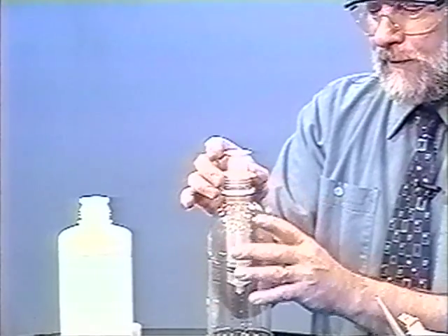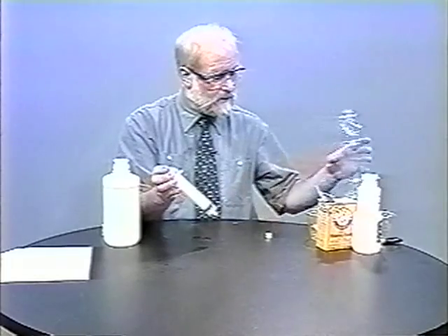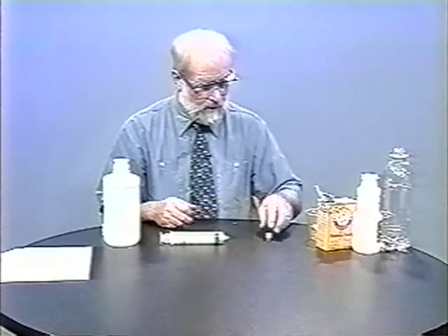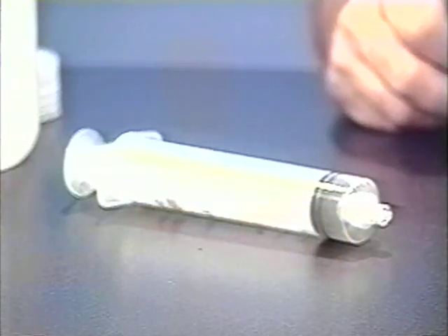So now the solid reagent is in the syringe, and you can actually set that down — it won't come out. The diaphragm is stuck inside the little cap and we're ready for the next part. Incidentally, this is the reagent that's normally the limiting reagent.